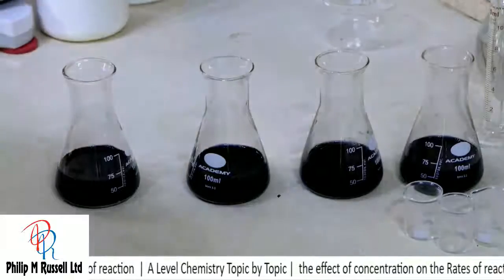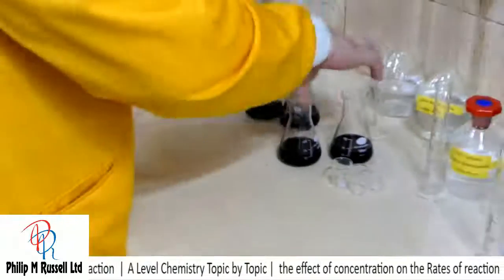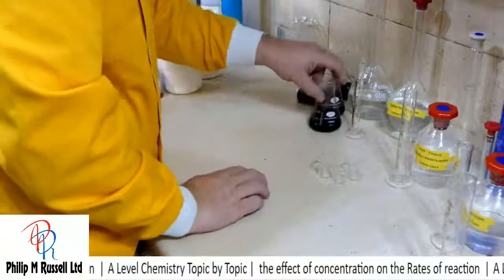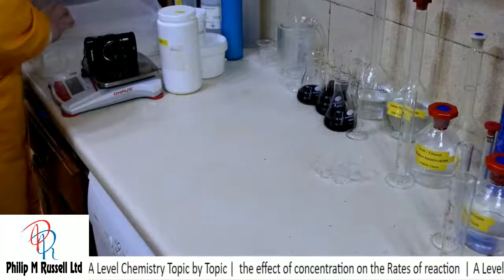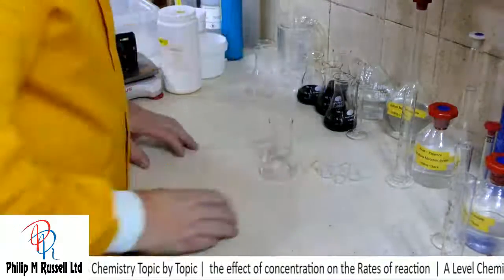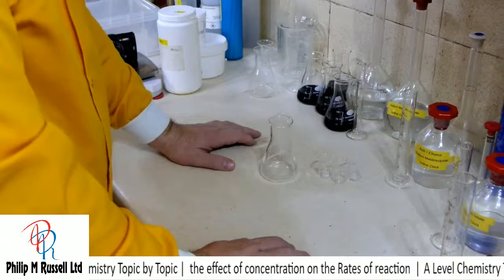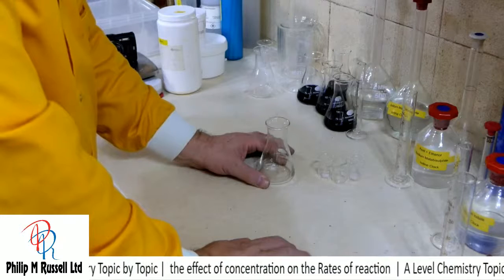So I'm already collecting up here quite a few conical flasks. It's going to give me a fair bit of washing up to do. And let's take a couple more and have a look at these. So this time we're going to be a little bit more careful with our reaction, and we're going to try and decide how much that we want to try and do.